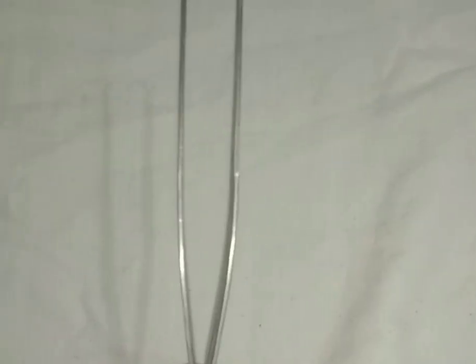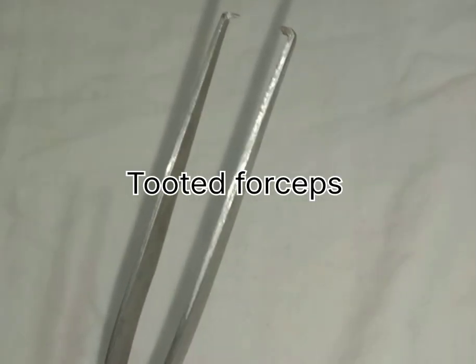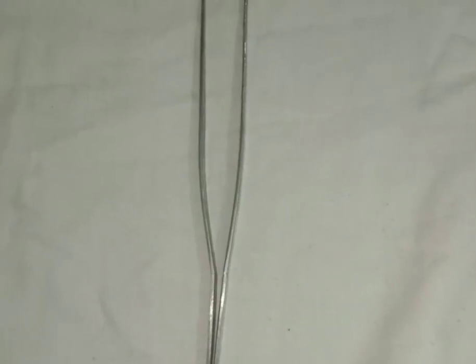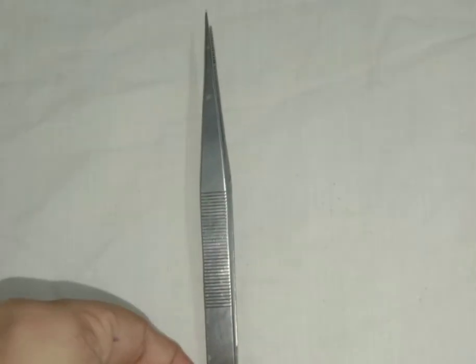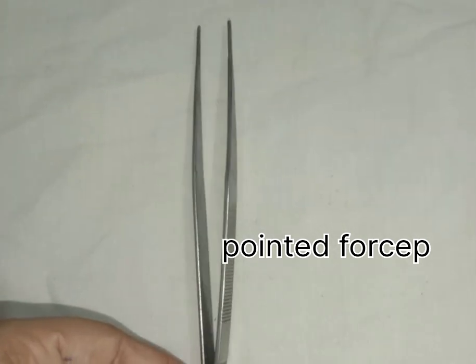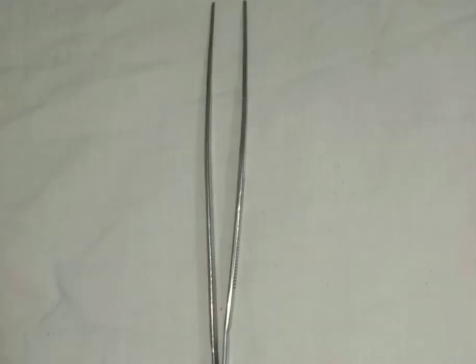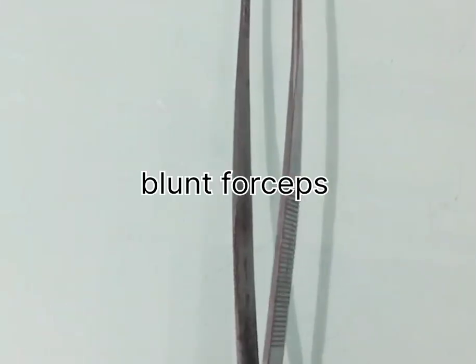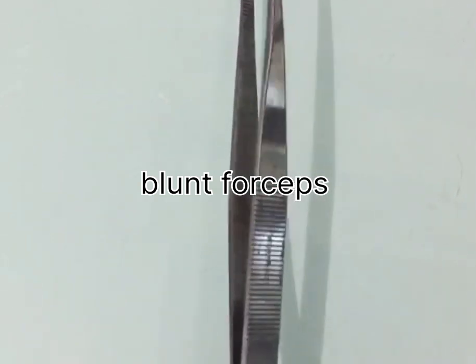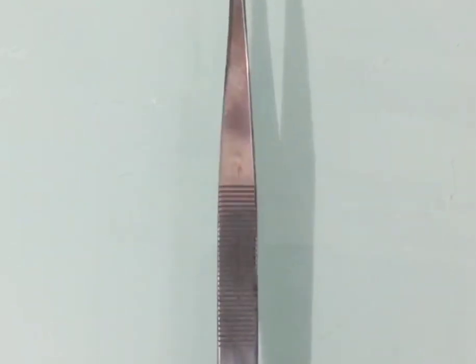They are tooth forceps, pointed forceps and blunt or plain forceps. The first one, tooth forceps, is generally used for holding the muscles during dissection. Next is the pointed forceps, generally used for holding any kind of nerve or artery or vein during the process of dissection. And the other type is the blunt forceps, which is used for holding the organs, muscles and the cartilage. Mainly, these forceps are used in the process of dissection to avoid any kind of damage.